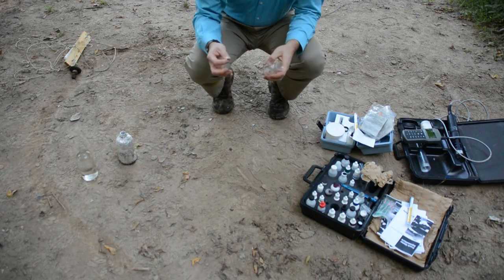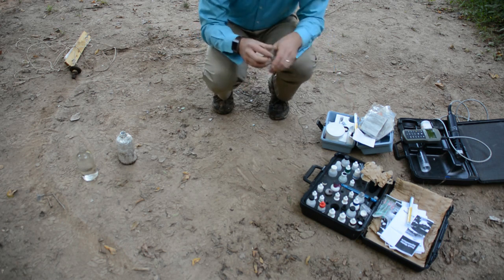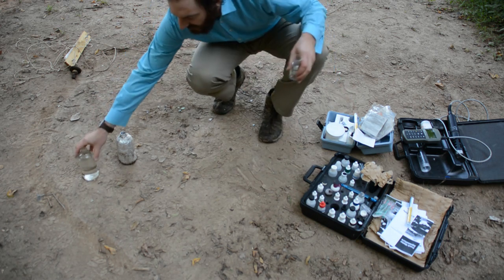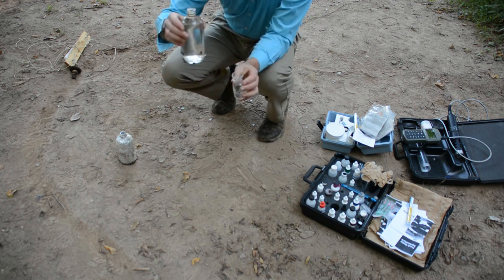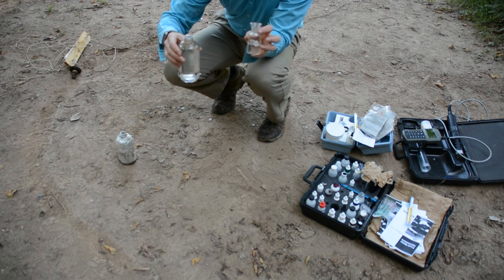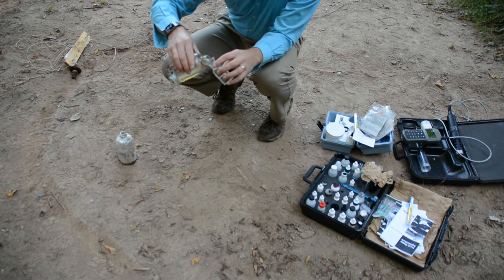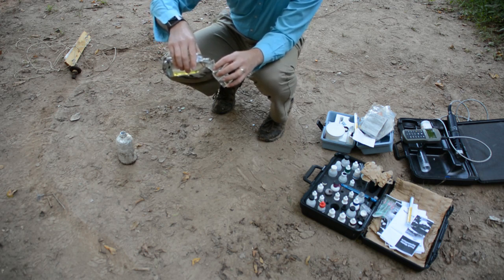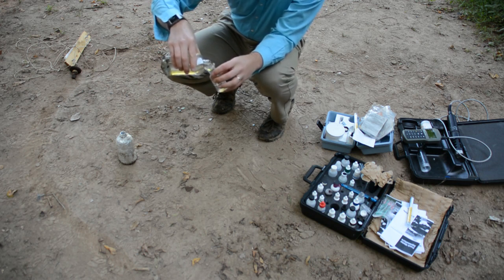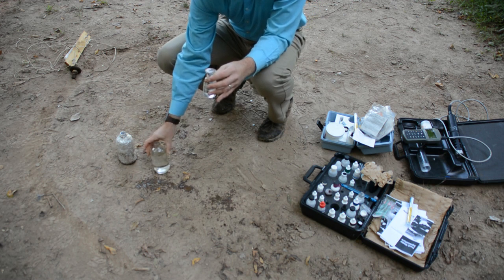So here I am. I'm going to run the first dissolved oxygen test, and we'll just show you a little bit of the reaction here. I don't want to waste all my camera battery, it's getting pretty low, so I don't know how much time I have, but I'm going to fill this small sampling bottle with the sample, and I'm going to do it very, very carefully so as not to get any extra air in there. I don't want to agitate it too much. I'm going to overfill it because it's okay, I've got extra water.